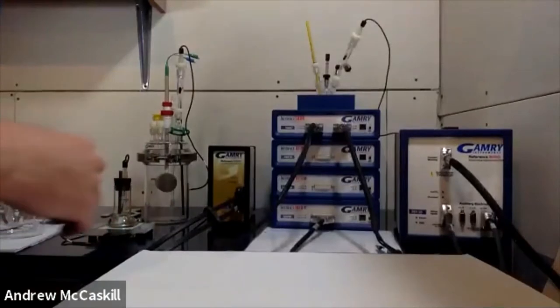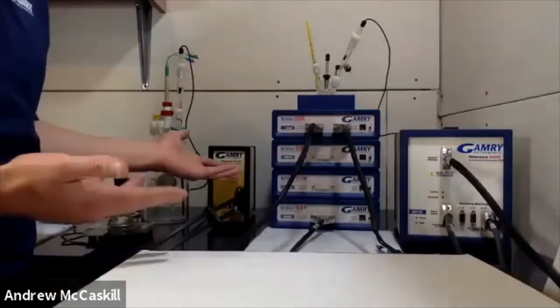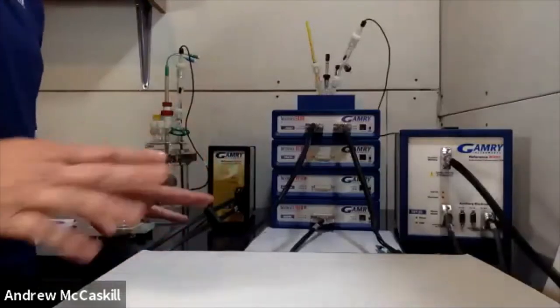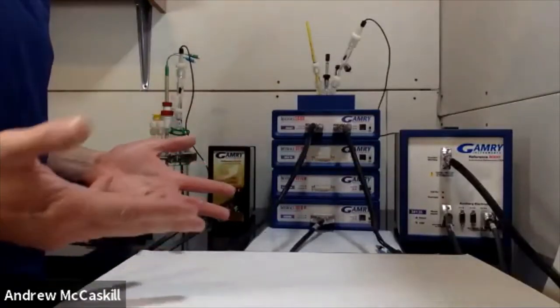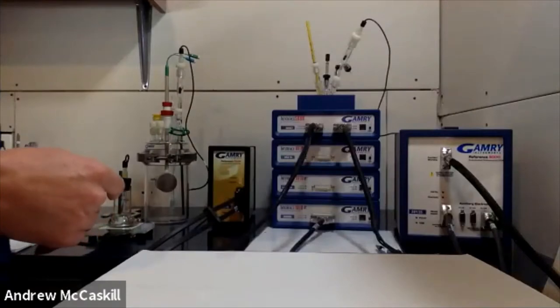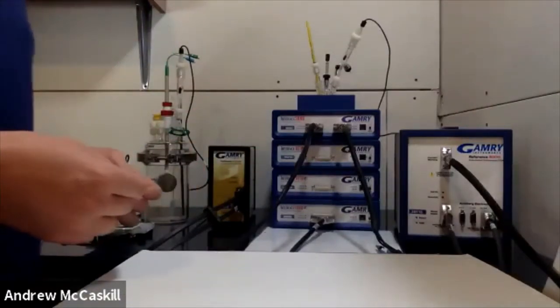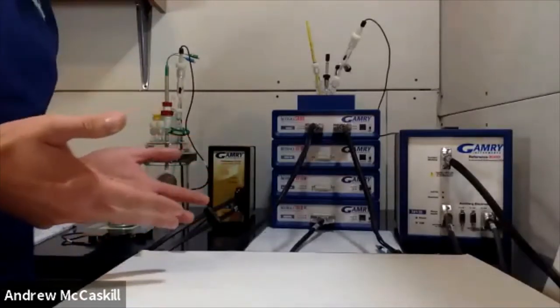As you can see in the background, we have many of our potentiostats and I'm going to connect each of these to the various cells depending on the application that would probably work best for it. As I go through each cell, we'll talk about how I constructed it, what it's used for, and why it was designed the way it was.